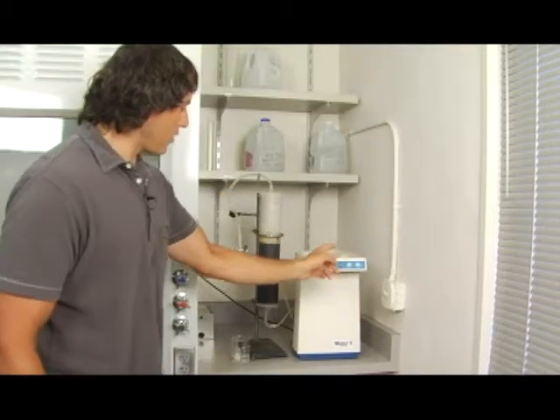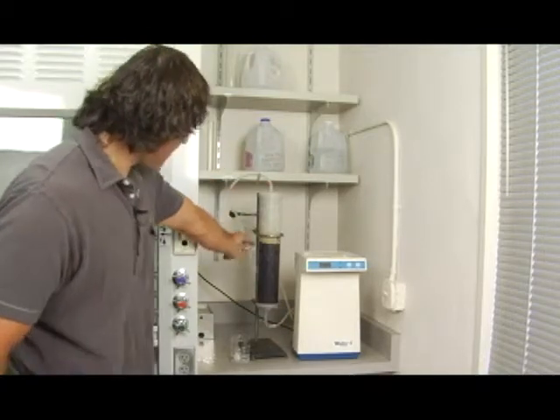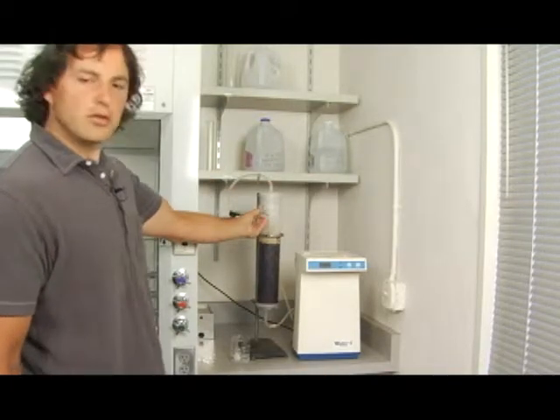So the water will flow out of here, be forced through the deionizing unit up through the bottom, come out the top, and then you'll be using this valve here to get your water.